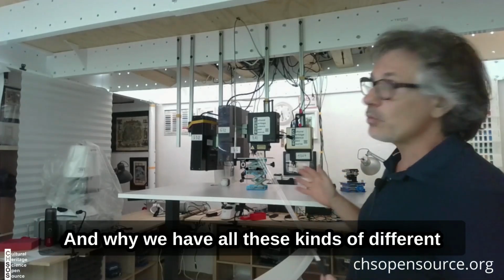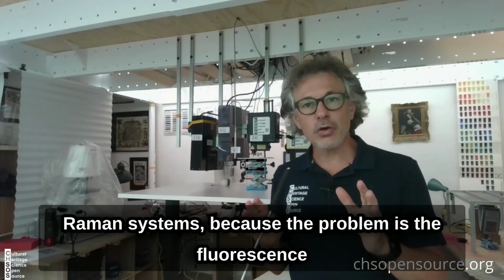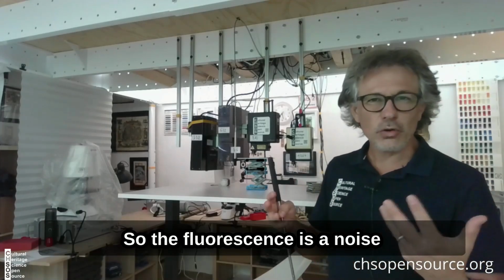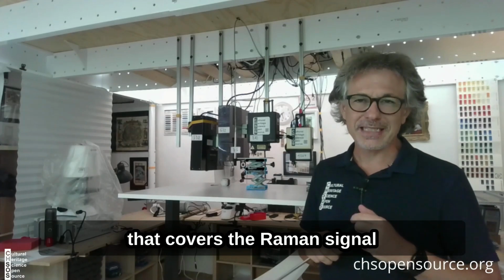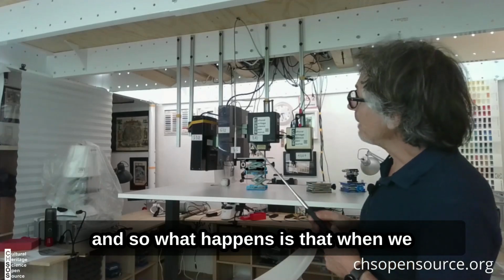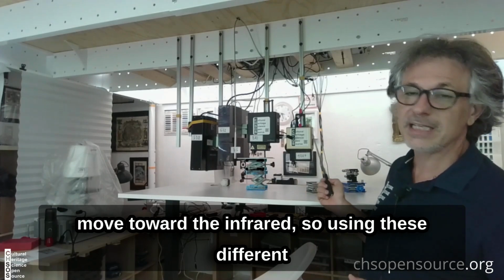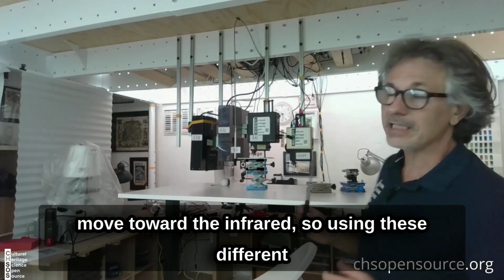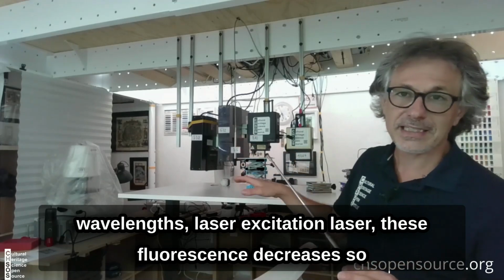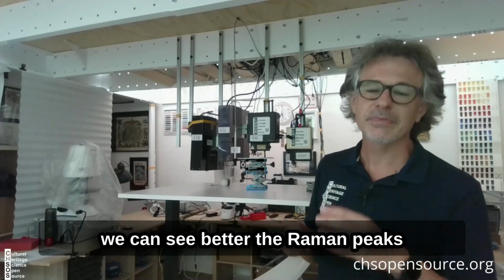And why do we have all these different Raman systems? Because the problem is the fluorescence. The fluorescence is a noise that covers the Raman signal, which is what we need to discover. When we move toward the infrared, using these different excitation laser wavelengths, this fluorescence decreases, so we can see the Raman peaks better.